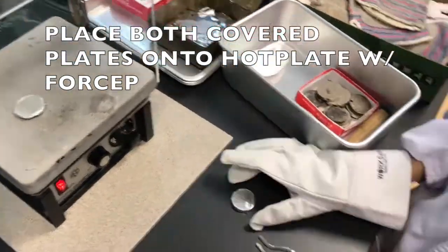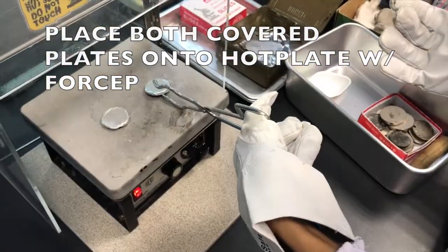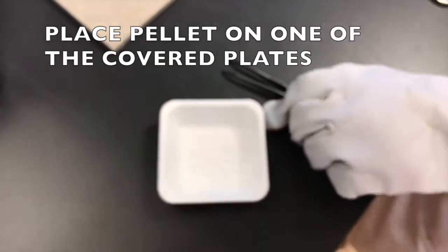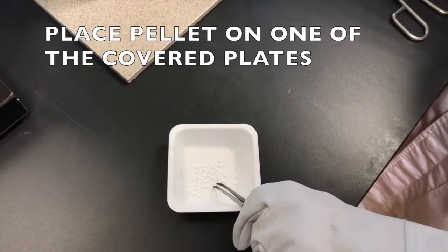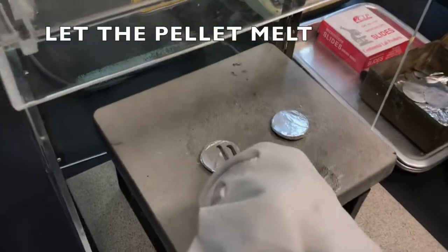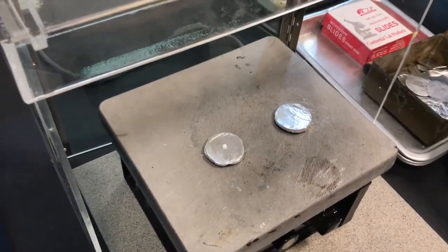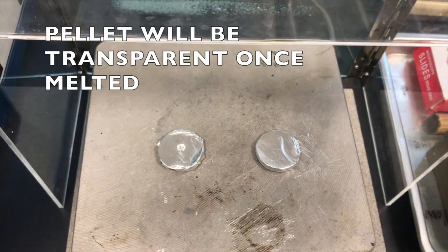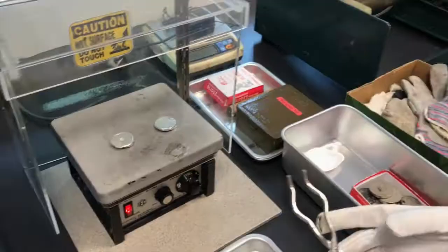Afterwards, we put the two covered metal plates onto the hot plate using forceps. Using the tweezers, put one of the polymer resins on top of the aluminium foil. Then we will have to wait for the resin sample to melt by observing the change from opaque to transparent, which takes quite a bit of time depending on the melt temperature of the polymer resin.